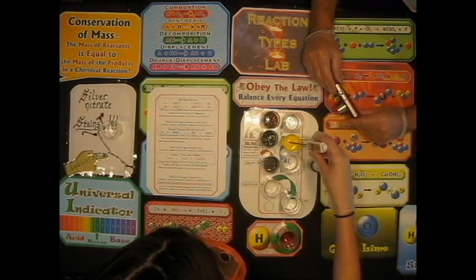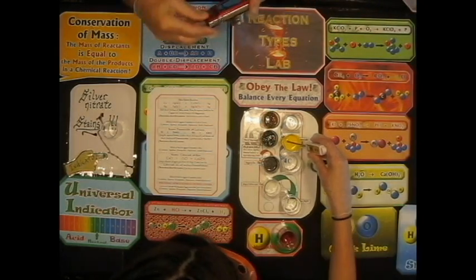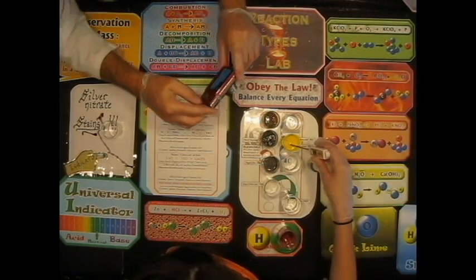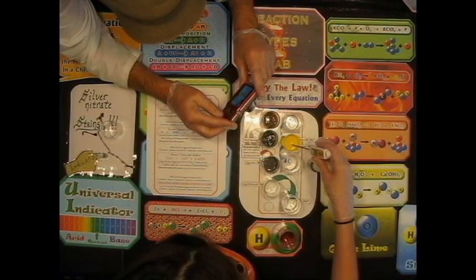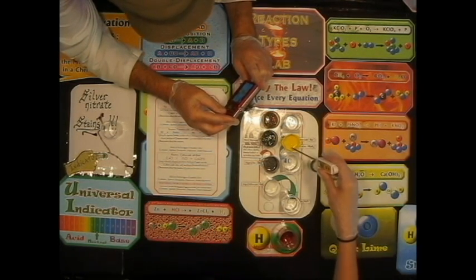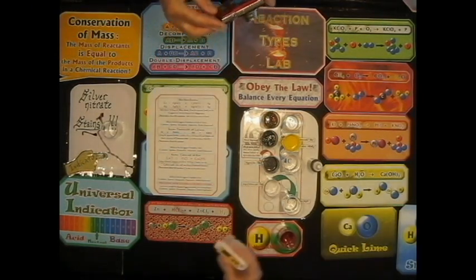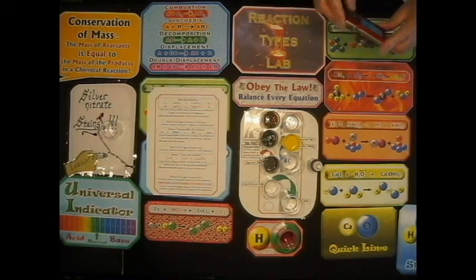Some reactions don't mess around. Some reactions are instantaneous, right? Get a temperature. It'd be around 24.4 Celsius. Okay, just give it a second. It has to adjust. But 24.4. Okay, and then we'll measure the temperature again in a few minutes. It's yellow. Is that pretty? Yeah.